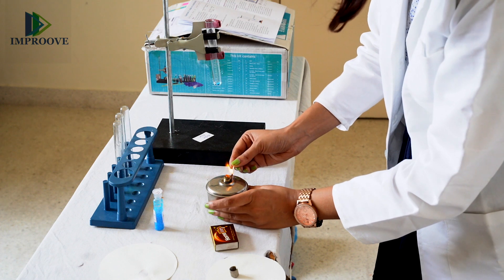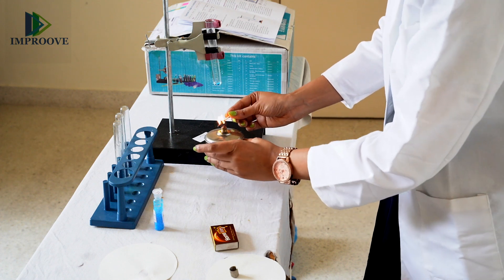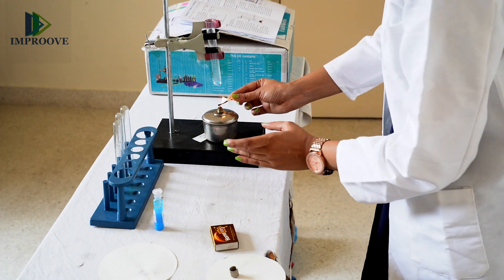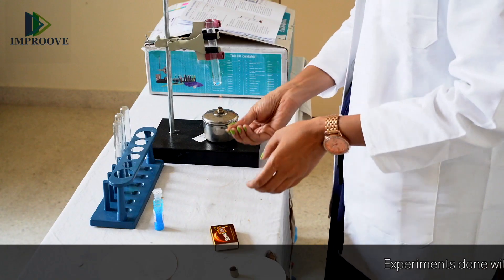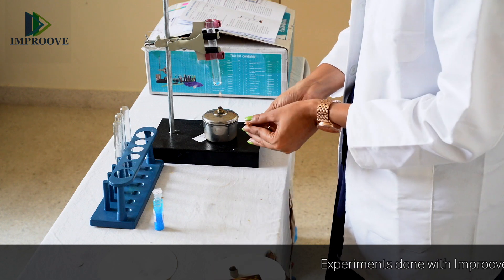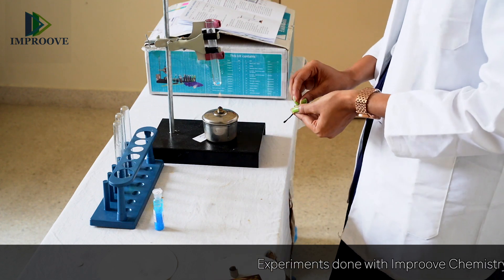The heating will take some time and the colour change will take some time, as there is a particular temperature at which copper sulphate will lose its water of crystallization, and that is about 250 degrees Celsius. So we will set this aside and allow it to heat.